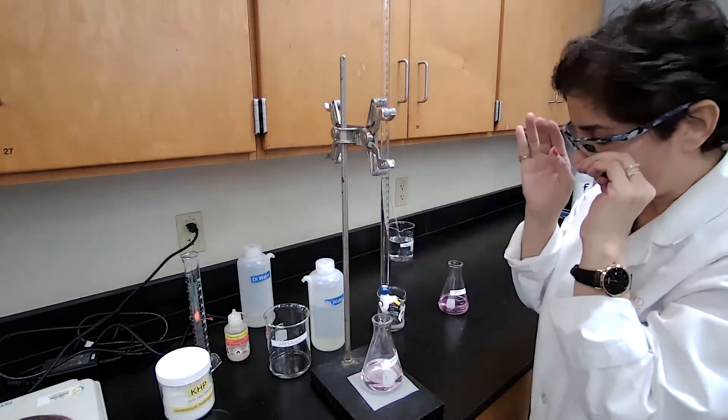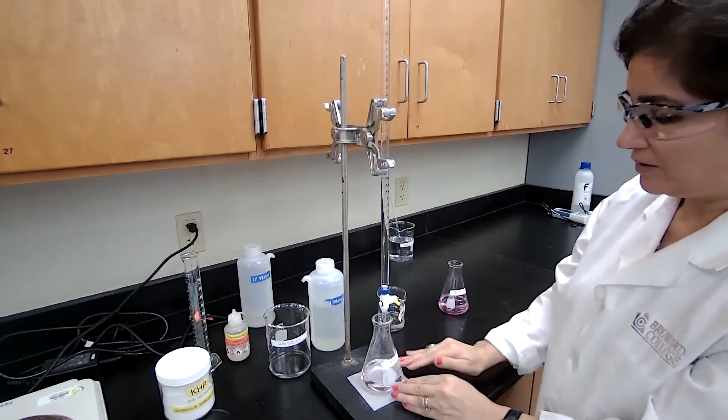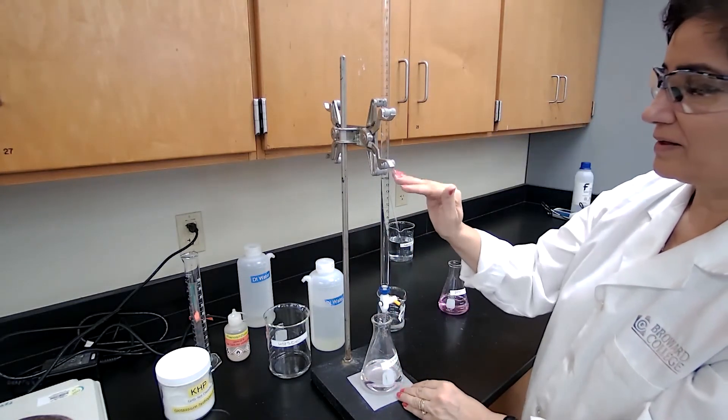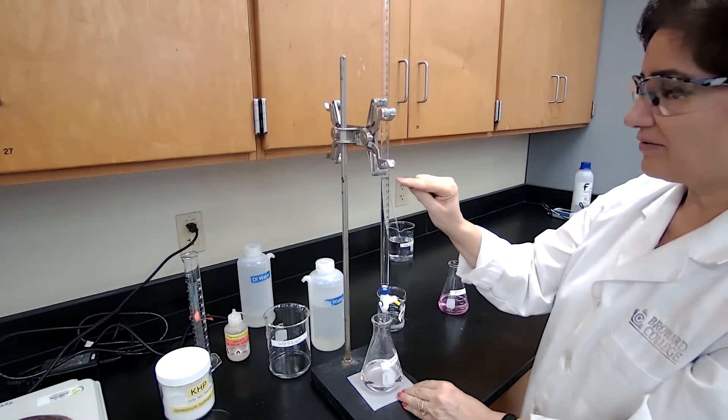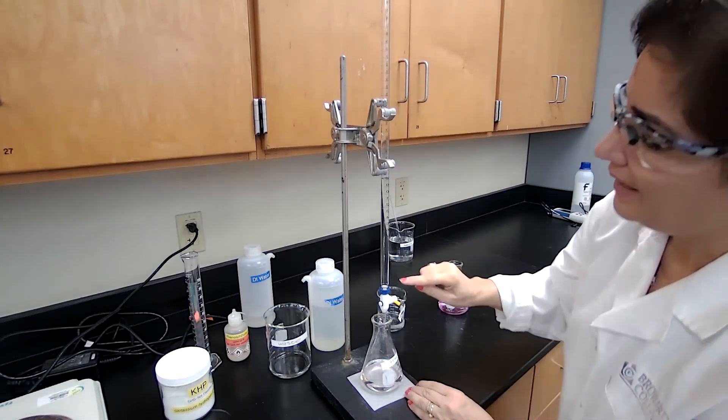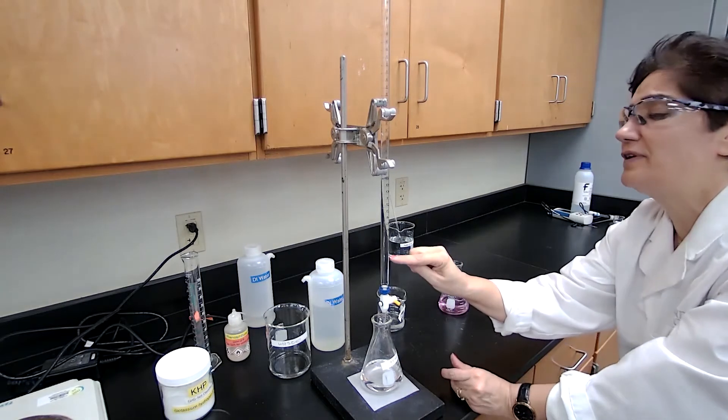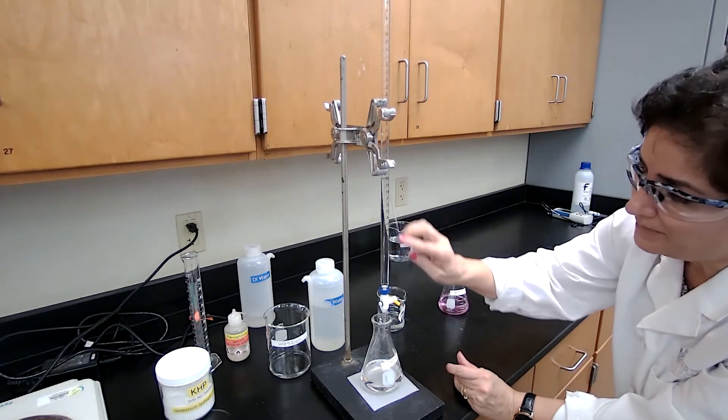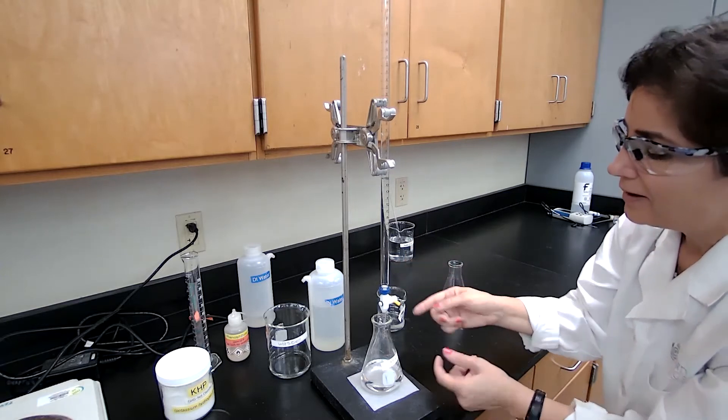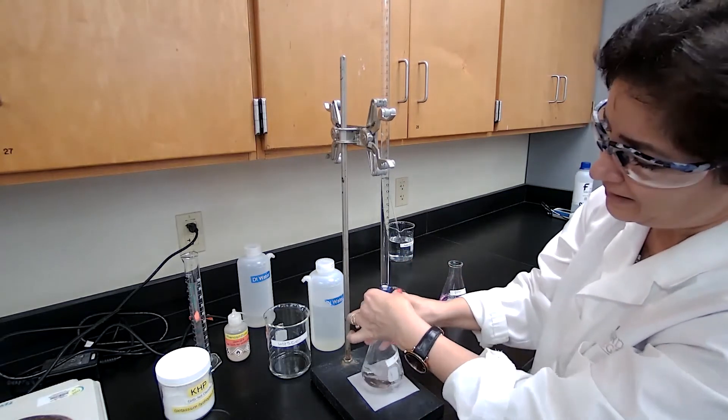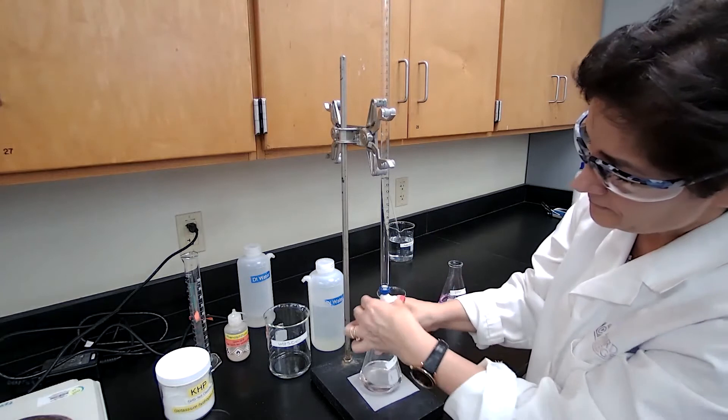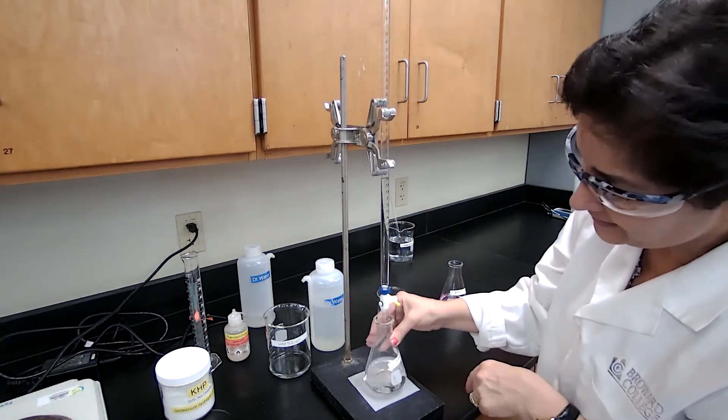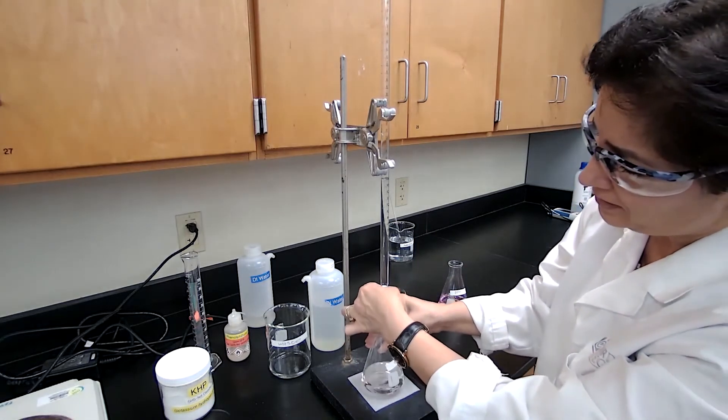The correct technique for this one is to be worried about the color change, not to be worried about the line or the level of the liquid in the burette. Unless you're reaching this line of 50. Below 50, there is no graduation. You just want to make sure that you don't pass that. Otherwise, you add slowly and stir it constantly.